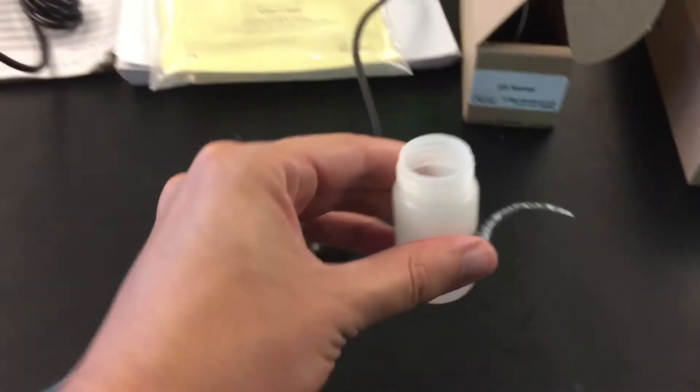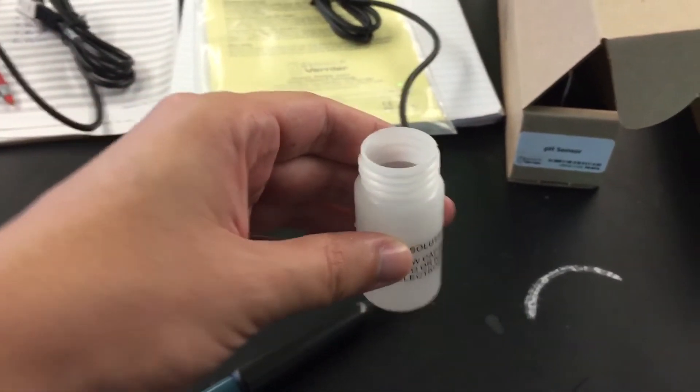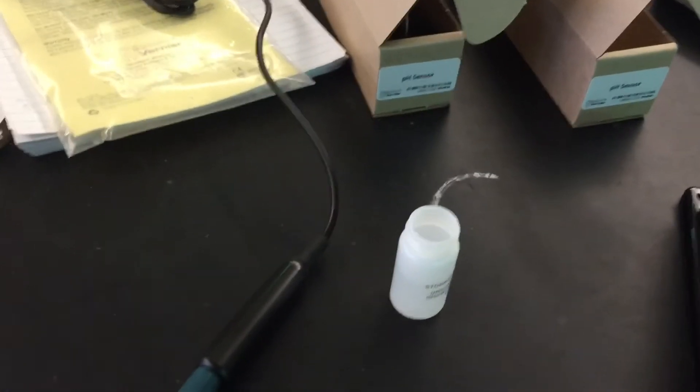This solution, do not spill, do not mess around with this. We only have a couple of them.